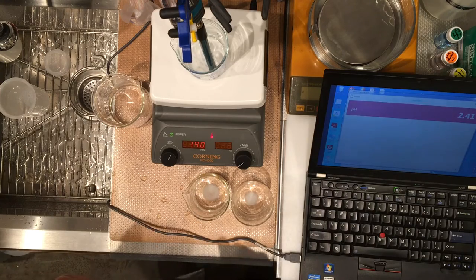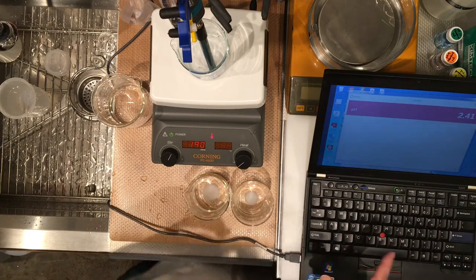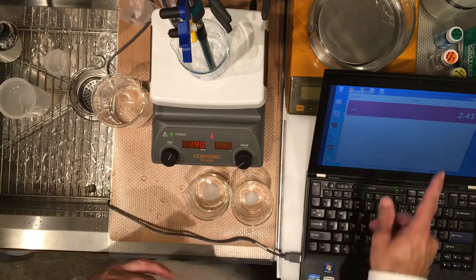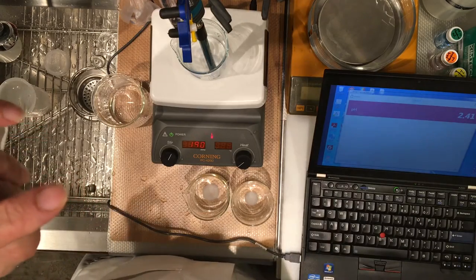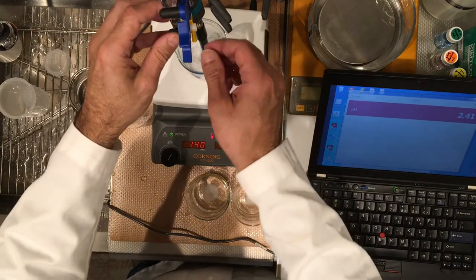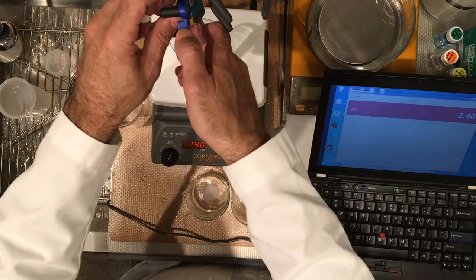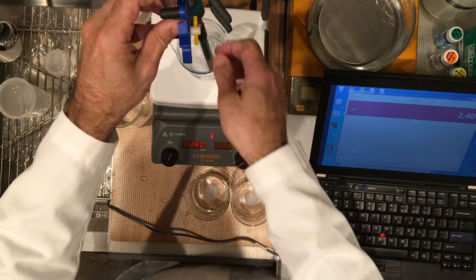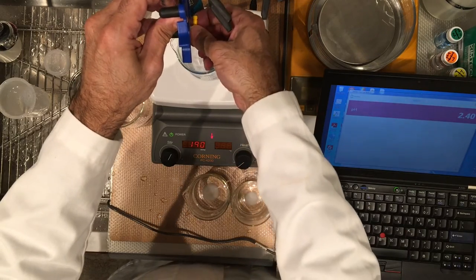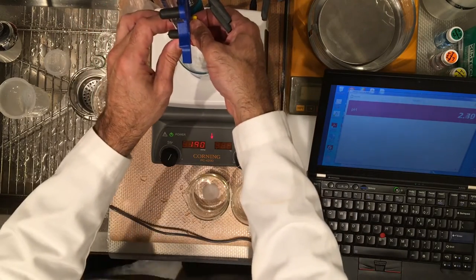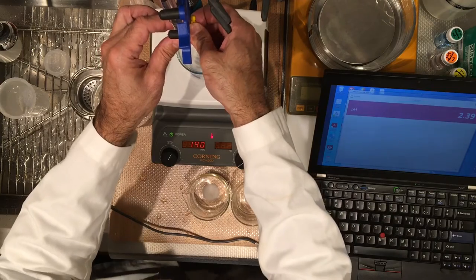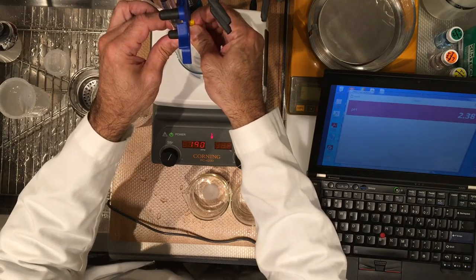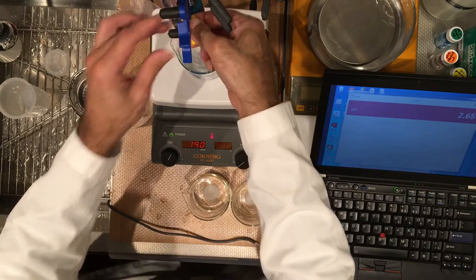And you had your reading of the pH. So, now let's start with the first pH you already have. Not this one, the reading recorded. And that's at the zero milliliters of the base added. So, we haven't added any base yet. So, let's go ahead and add in increments of 0.5. First increment is 0.50 milliliters.